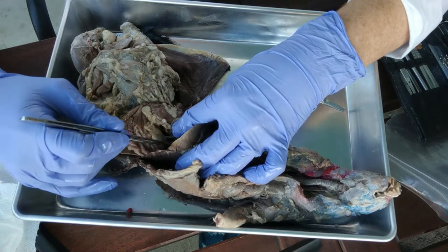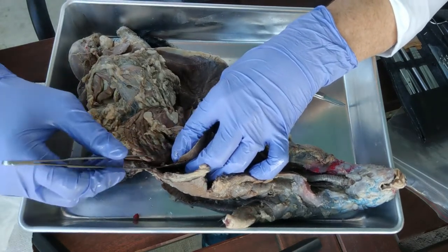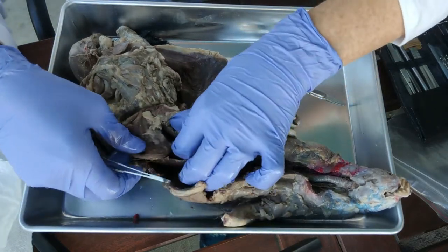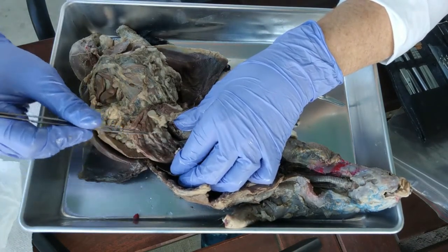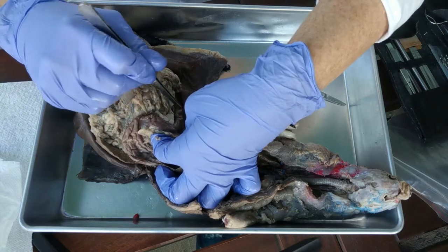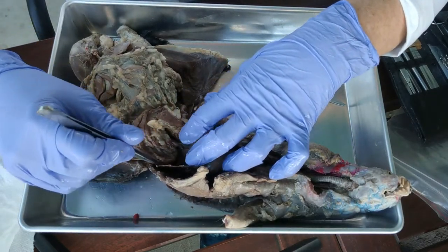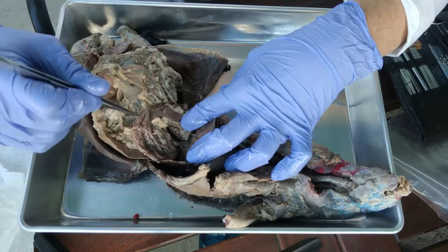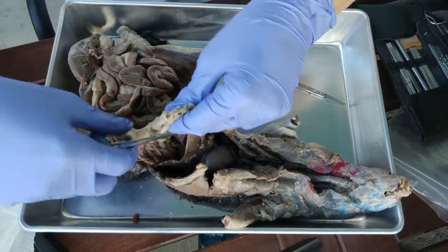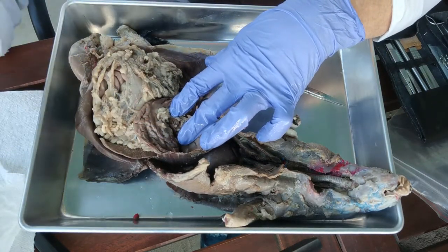The esophagus goes through the diaphragm and empties into the stomach. The region where it empties is the cardiac region of the stomach. Coming off that is the first expanded pouch — the fundus. Then we have the body of the stomach, and the last tail-like end before it empties into the small intestine is the pylorus. The stomach has two sides: the large side is the greater curvature and the small side is the lesser curvature. The greater omentum attaches to the greater curvature and the lesser omentum to the lesser curvature.